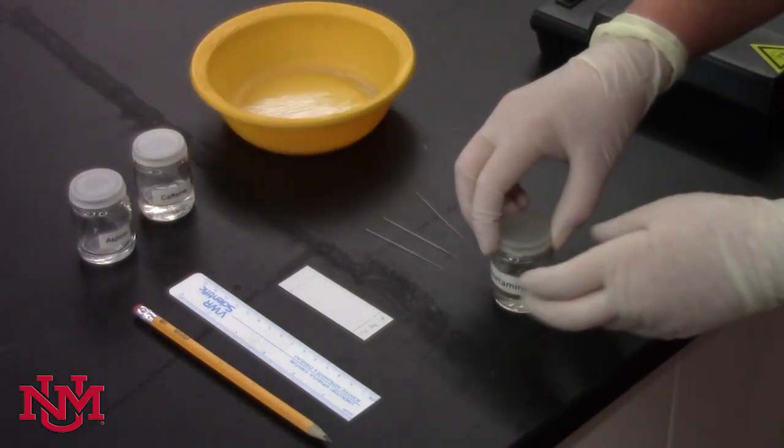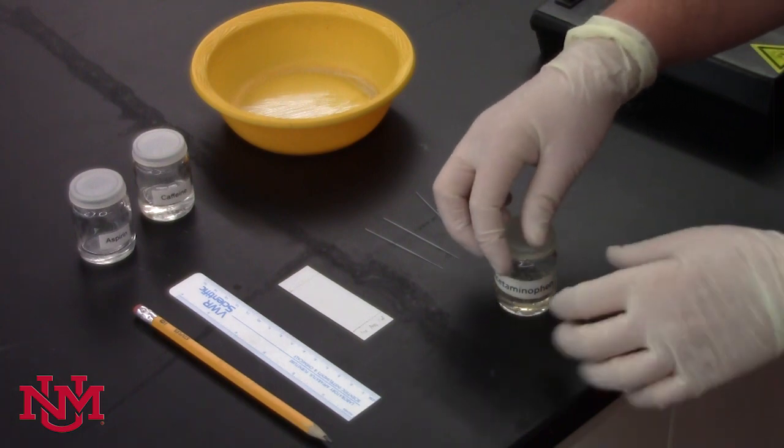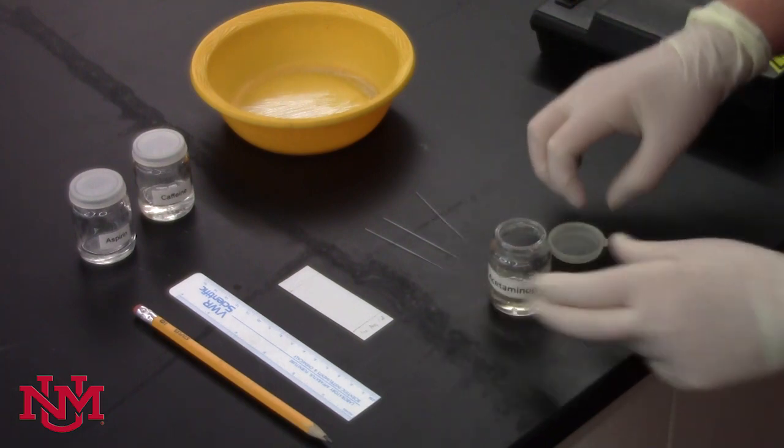Taking one of the standards, in your lab they'll be at three different benches so that you don't get them confused and contaminated. Remove the lid.